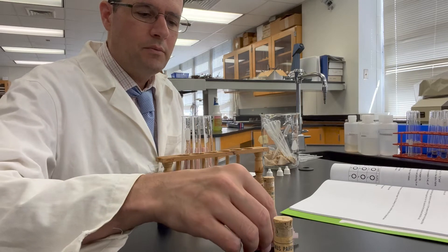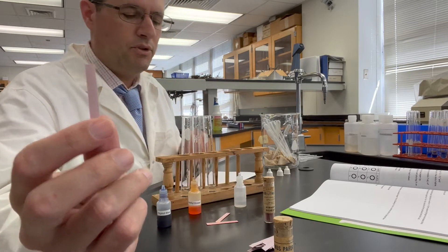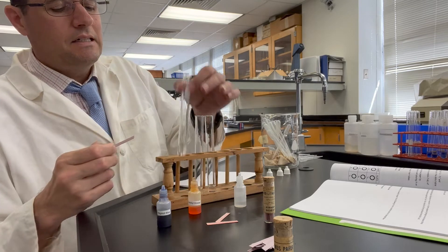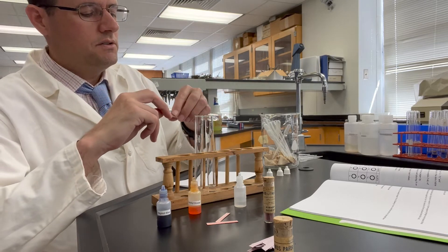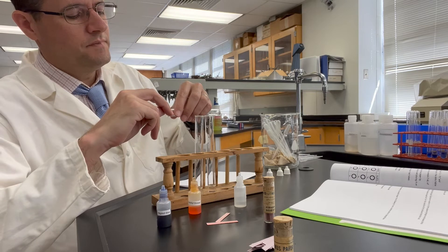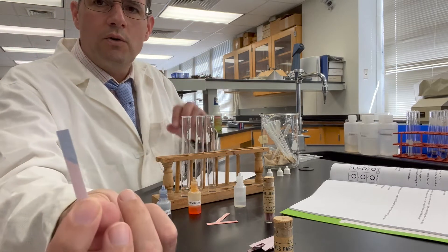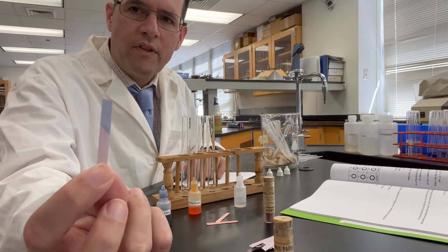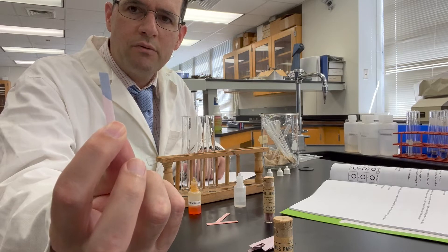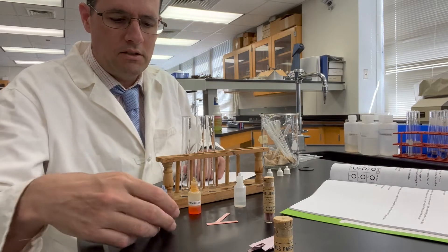Let's get the blue litmus paper now, which is kind of bluish tinged, and we shall place this into our solution. The tip of that paper has been placed into 0.1 molar sodium carbonate.